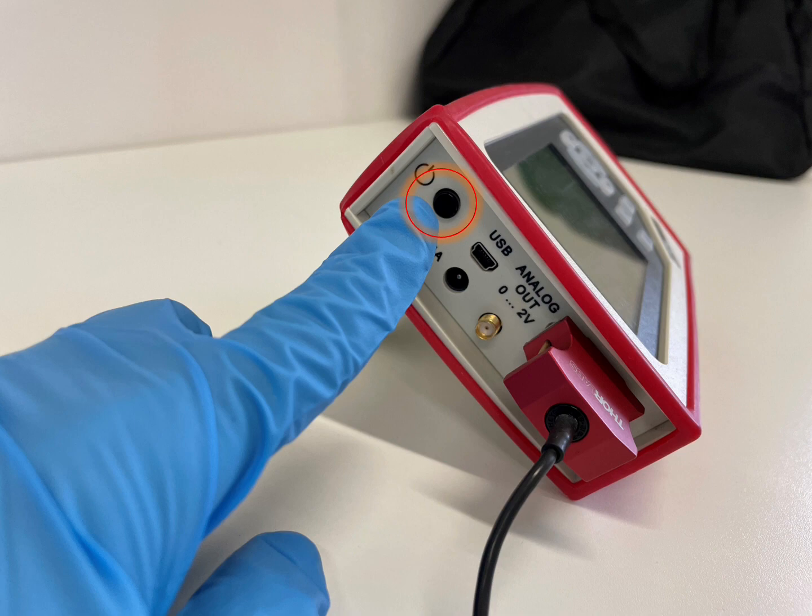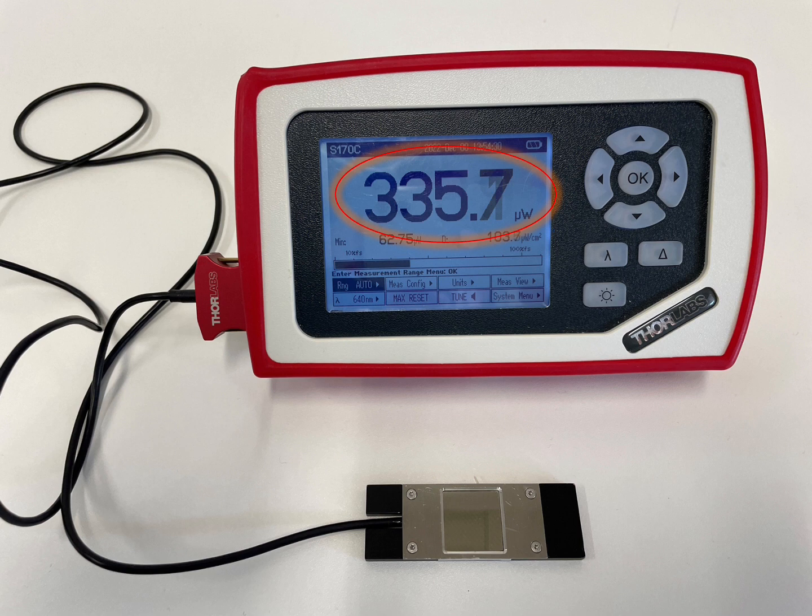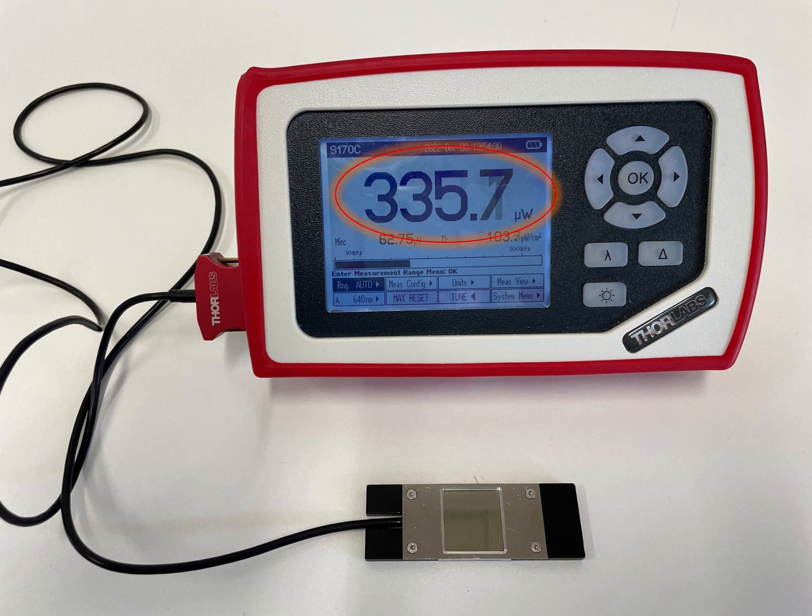Switch on the powermeter. The powermeter displays already the measured intensity. Right now, the powermeter indicates the amount of ambient light falling onto the sensor — it is 335.7 microwatts.